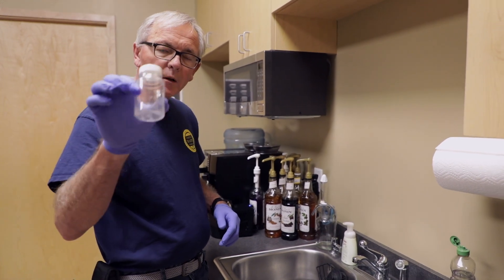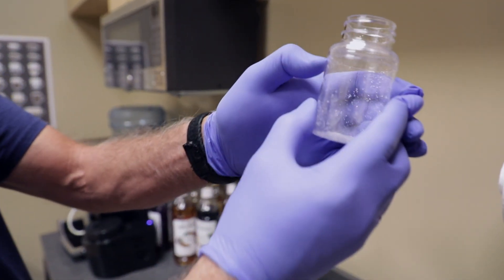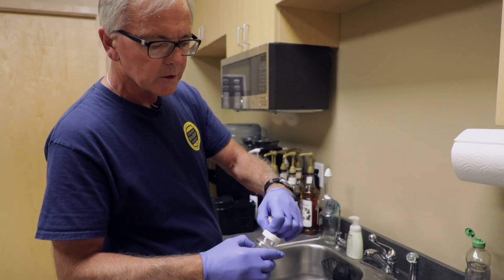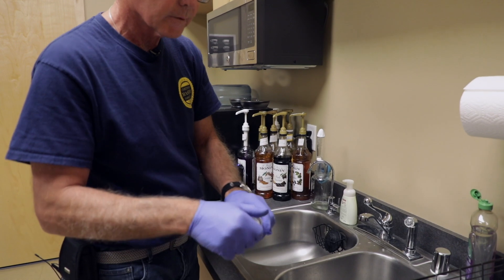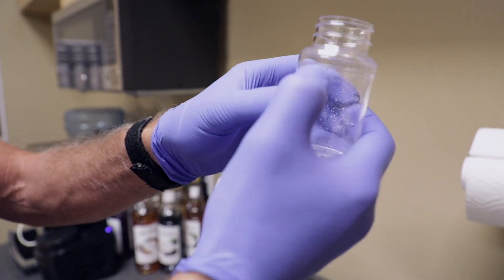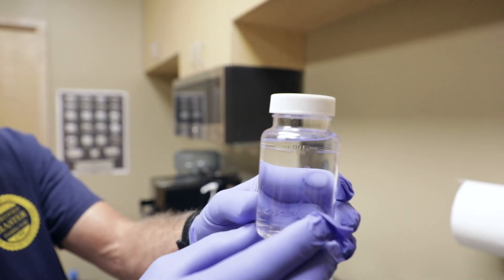This is a sanitized bottle I got from the lab. You'll see it's got white powder on the inside — this is a preservative. We don't want to rinse that out. It's got a sealer around the top on the lid. So we'll go ahead and remove our lid. Most of these bottles typically have a mark on them right there at 100 mils — that's where we want to fill our bottle to.